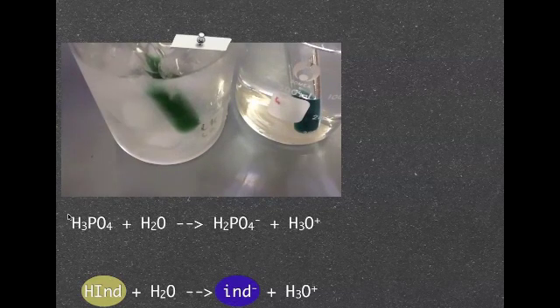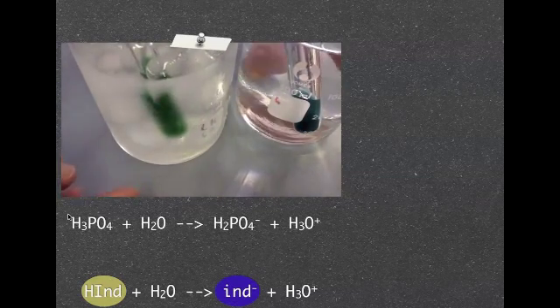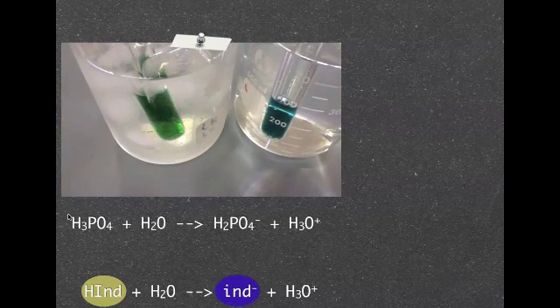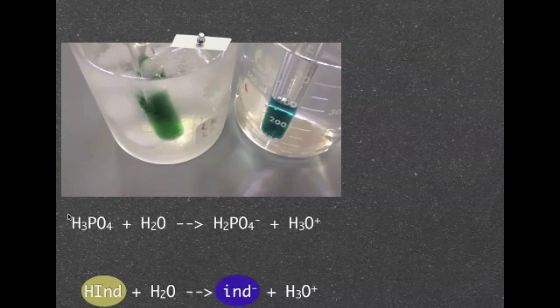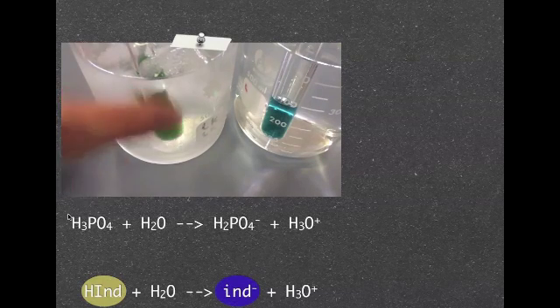Now let it there and now I start to speed the video up so you can see what happens. And once again, changing color.